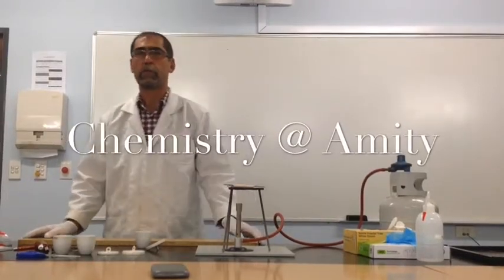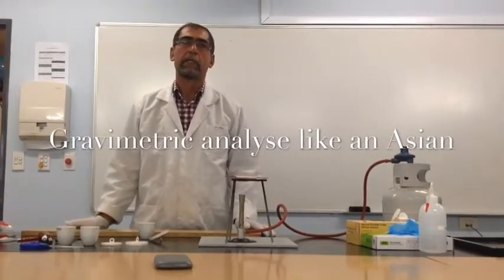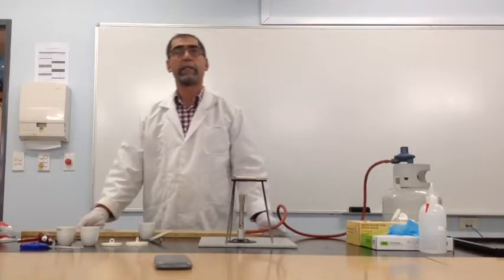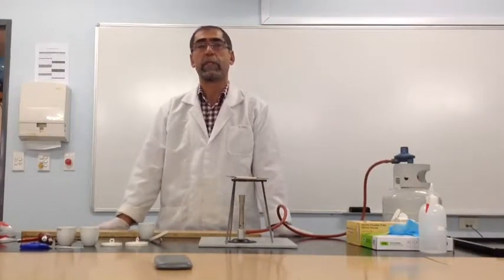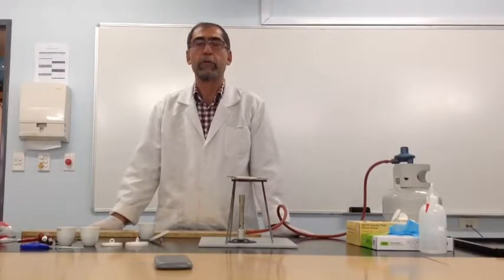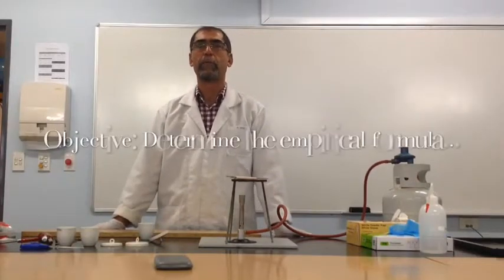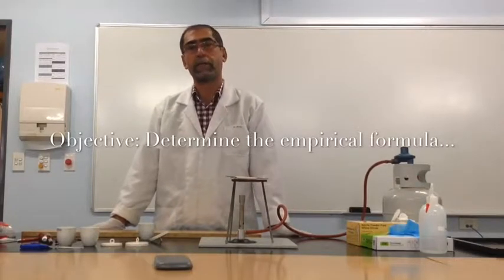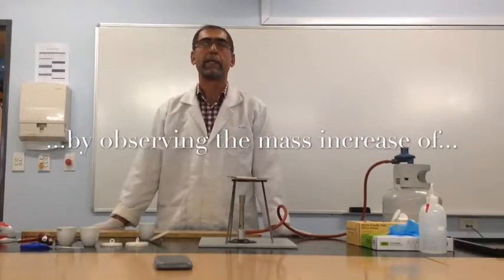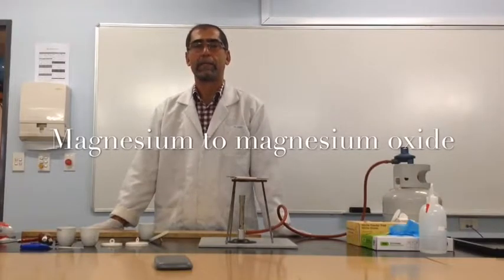Today we're going to look at the stoichiometric relationship between reactants in forming a product. The technique that we're going to use is based on gravimetry. Basically, this technique requires you to measure quantities in exact amounts using weight. Weight is gravimetry. So in this procedure, you will be paying a lot of attention to ensure the weight data is as representative as possible of the data that you're collecting.